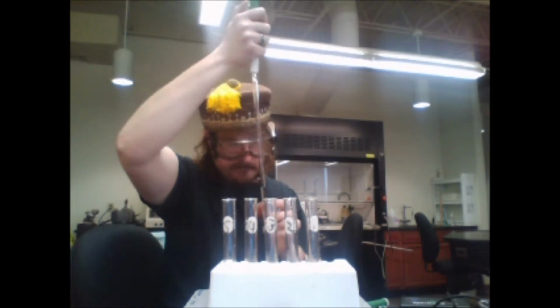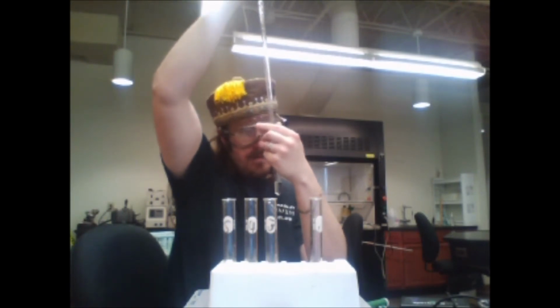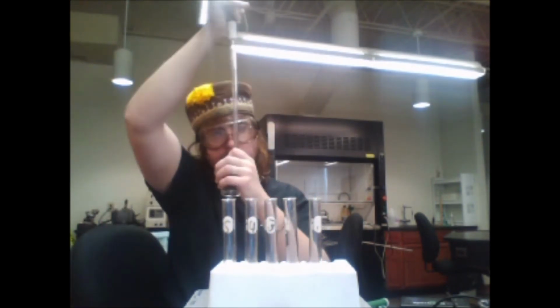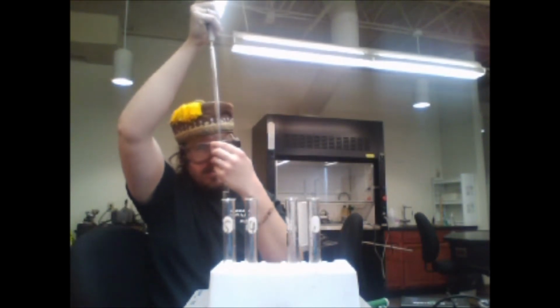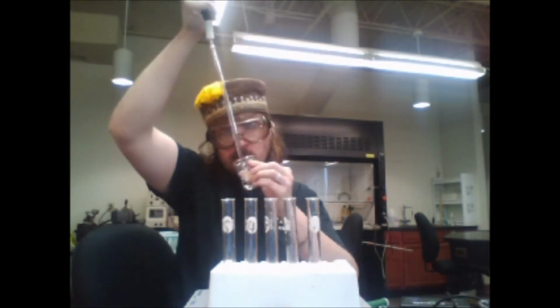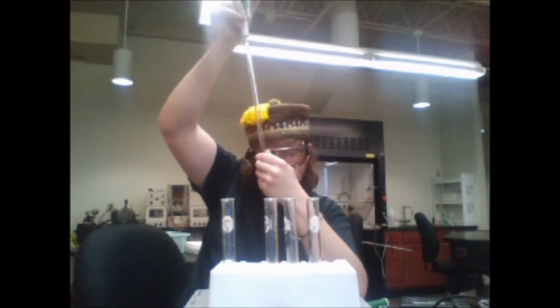Our first 5. Our second 5. Our third 5. Our fourth 5.